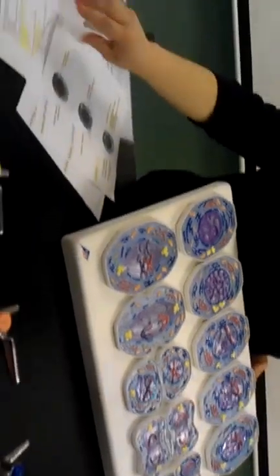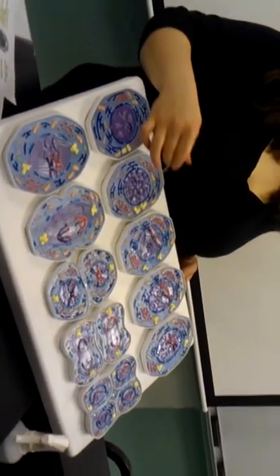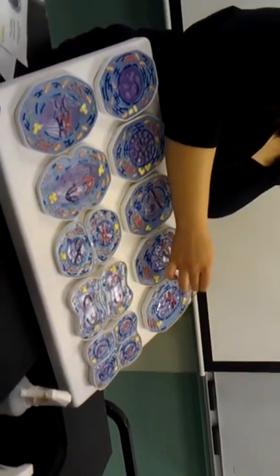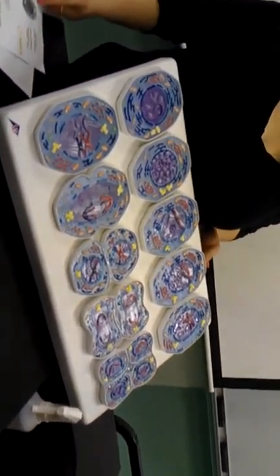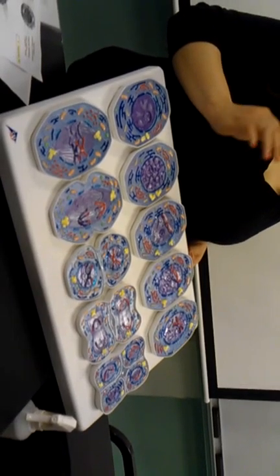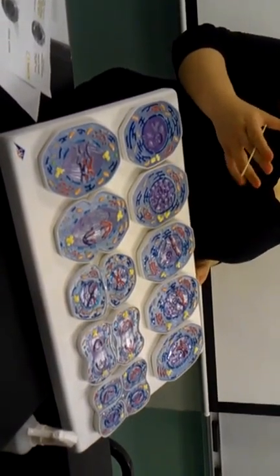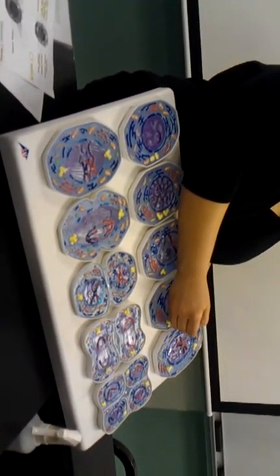So all of these were still in prophase, okay? And all of this on top, we're still in prophase. You just see the continuation. The spindles are going to opposite poles. You keep on getting more condensation of the chromosomes. Okay, now in prophase 1 is when you start to see the chromosomes are going to start to synapse together and form that chiasmata. Okay?